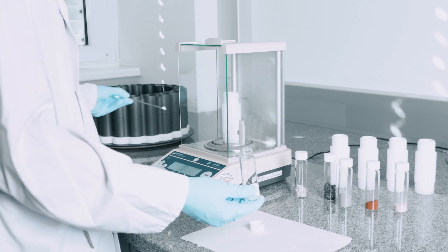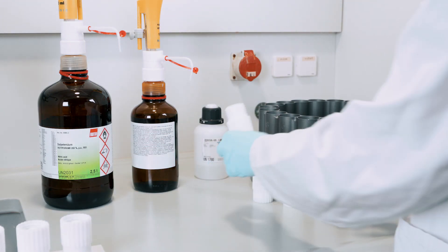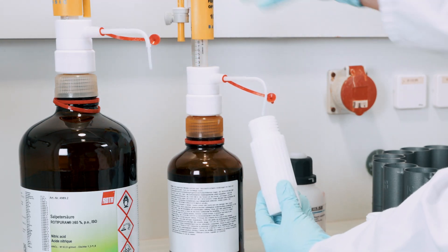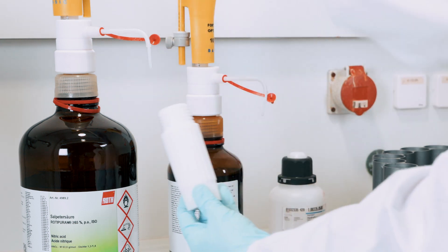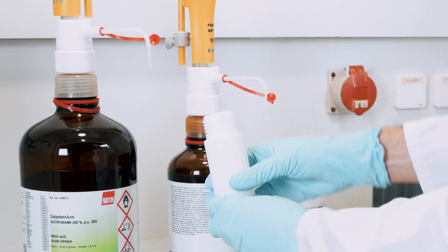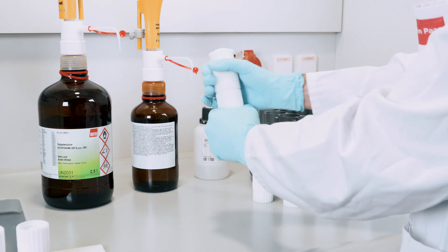First we weigh the sample. Then we add the acids. Different stones need different acid mixes depending on their composition. We close the vessel and put it into the rotor.